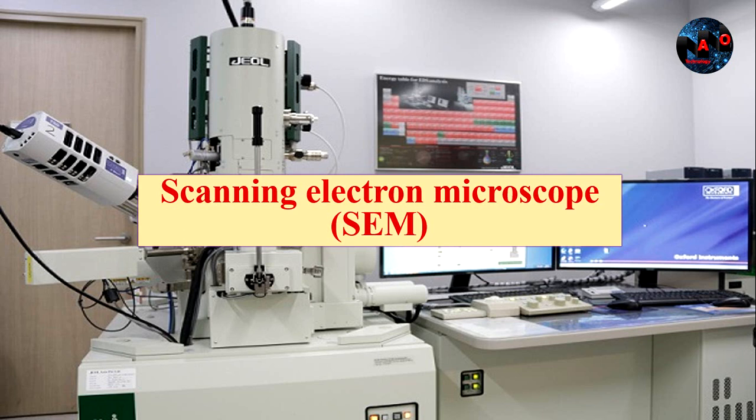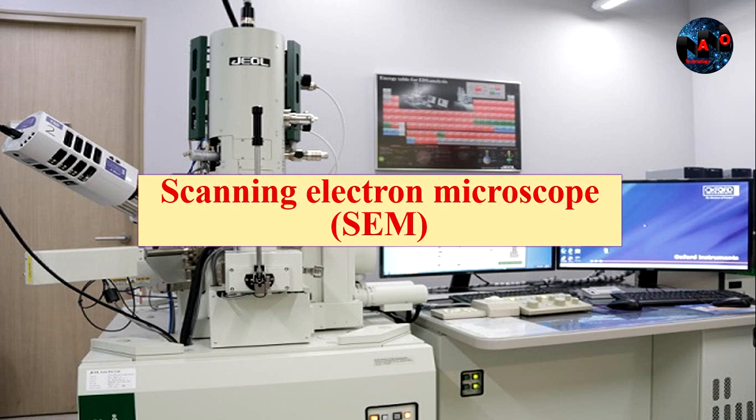In this video, I look at the basic principles and mechanism of scanning electron microscopy or SEM.